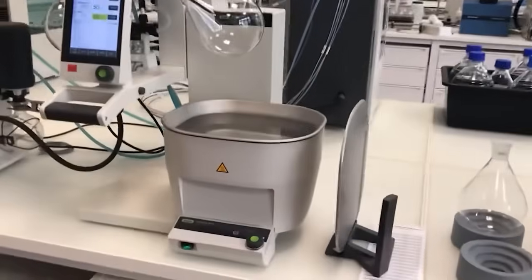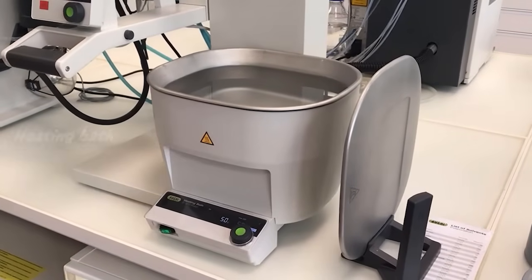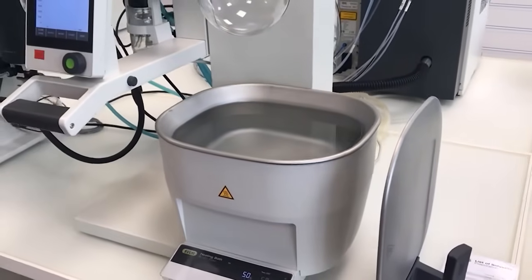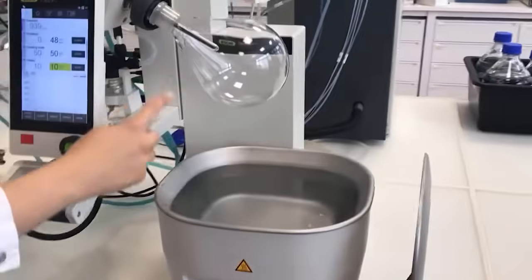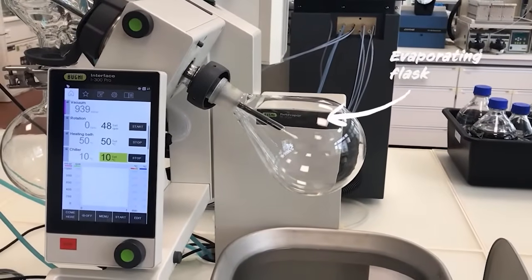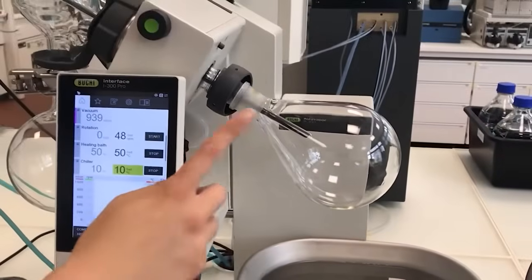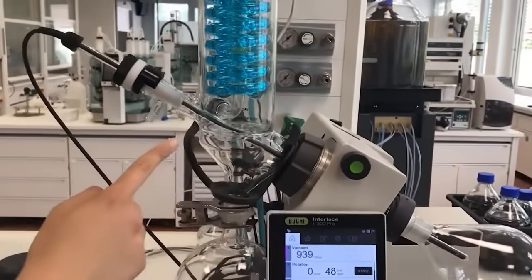Let's look at the individual components before we begin. Firstly, let's have a look at the heating part. This part consists of a heating bath and a heating medium, the latter being either water for moderate heating temperatures or oil for temperatures above 100 degrees. The flask with your sample will be attached to the glass joint and submerged into the heating medium.